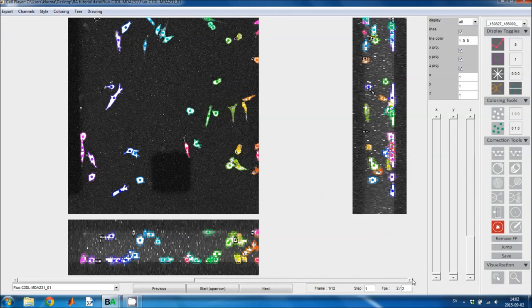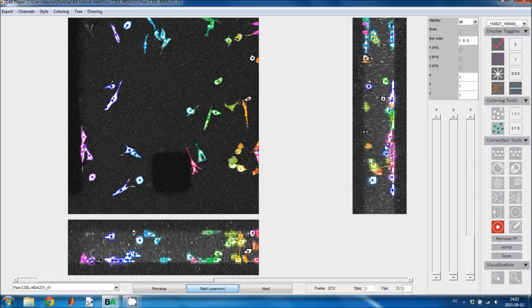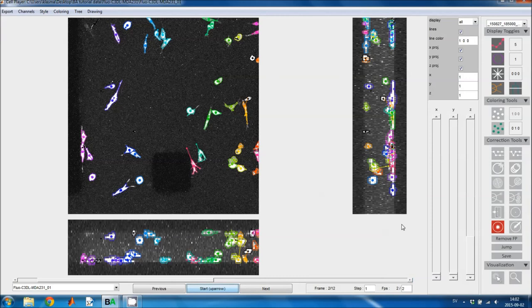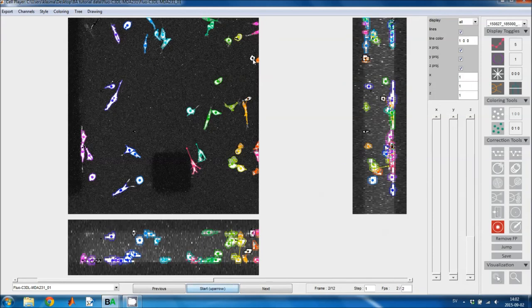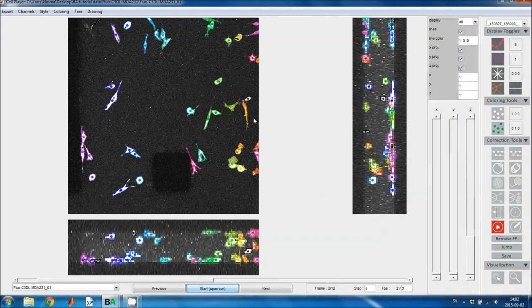And I don't see anything more here. I think this cell is probably, yeah, this cell shouldn't have been there, so I'll delete that one as well. Here is a cell which, now this is actually a cell, so I'll left click on it using the delete tool to get it back from this frame onward. So it's not in the first image, but it will be in all subsequent images.